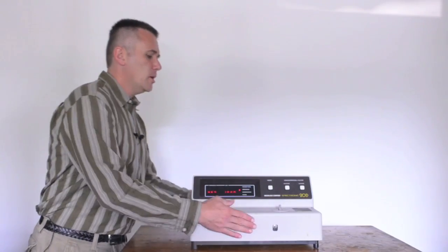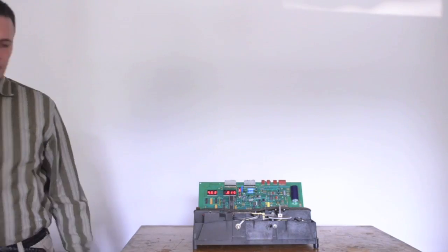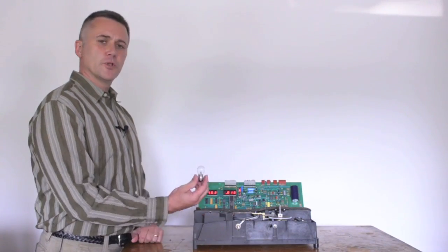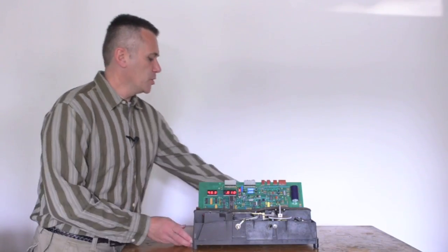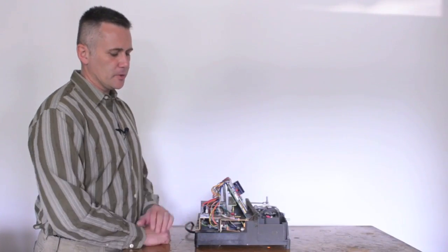And so we'll just pull off some of the knobs and this cover, and right away you can see some gears and a computer board, and these all work together to help make this instrument work. First, let's focus on the lamp. This is a spare lamp that we have, but there is one in this instrument, and as I turn this around, you can actually see the light coming from the spot right here.